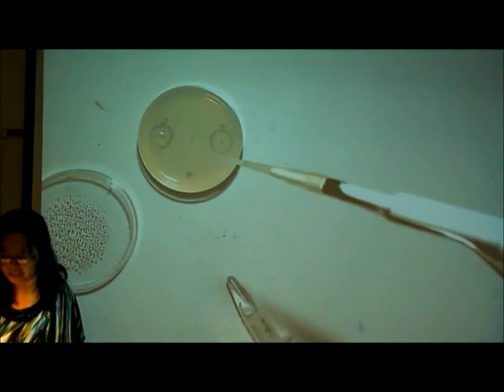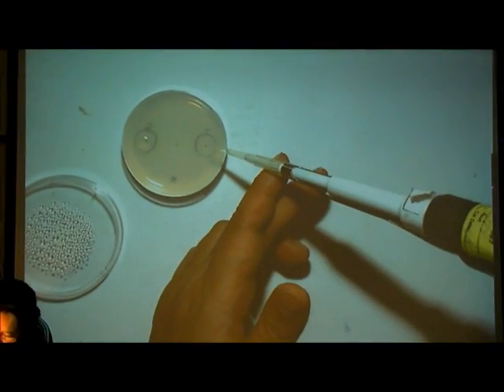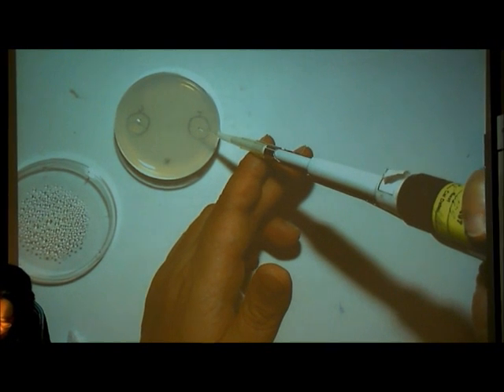When you are pulling it down, it is not necessary to be vertical. But when you are taking it from the tube, you have to do it like that.